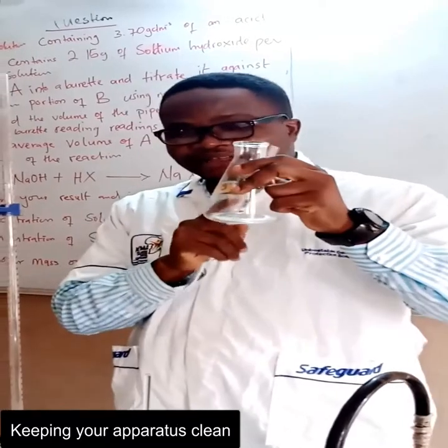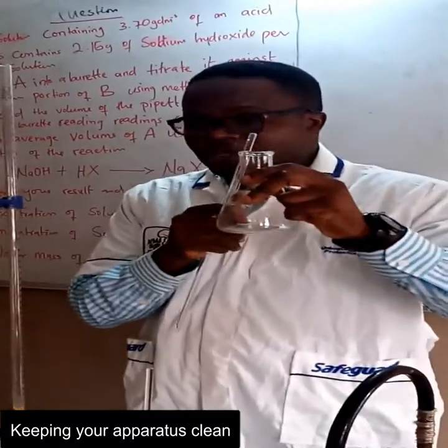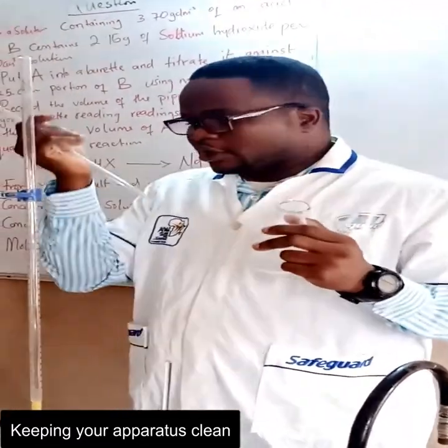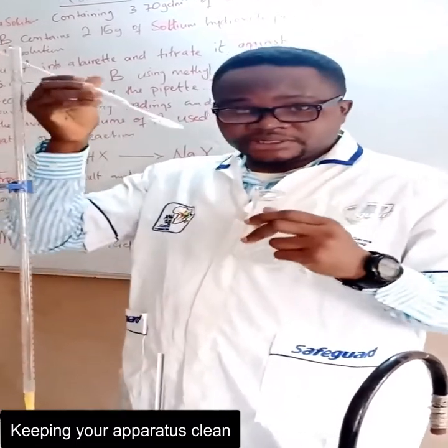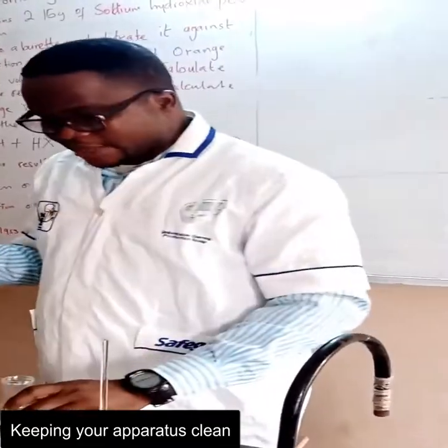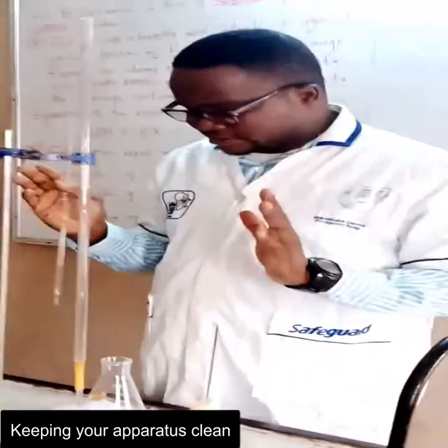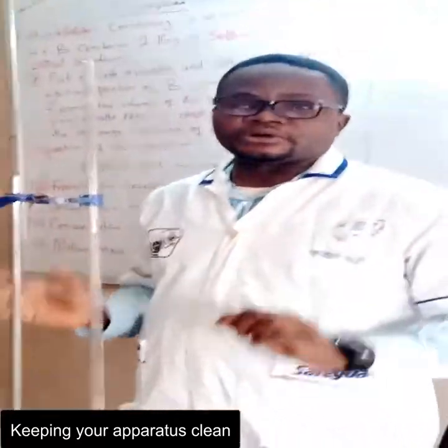Even if I have distilled water inside this particular conical flask up to the half level and I continue my titration, it doesn't affect my titration. Because the amount in moles of base still remains the same. So rinse your conical flask with water, while you rinse your burette with acid. That's about management of your apparatus.